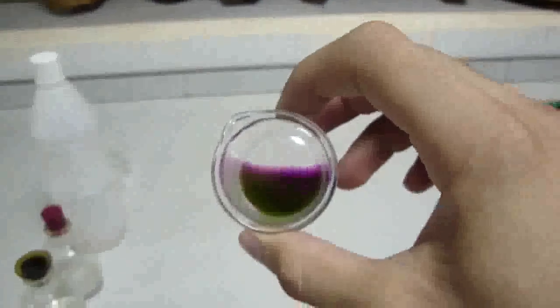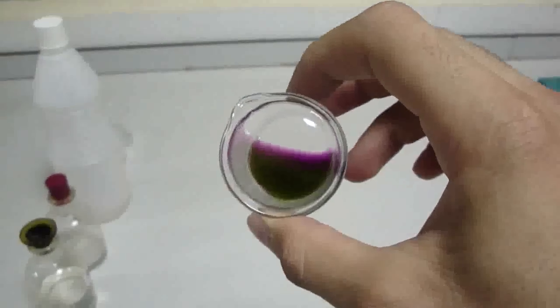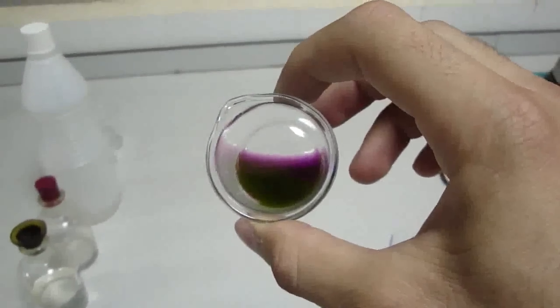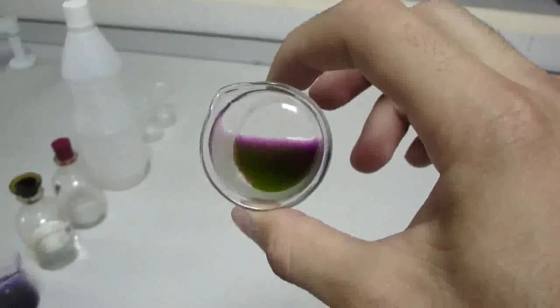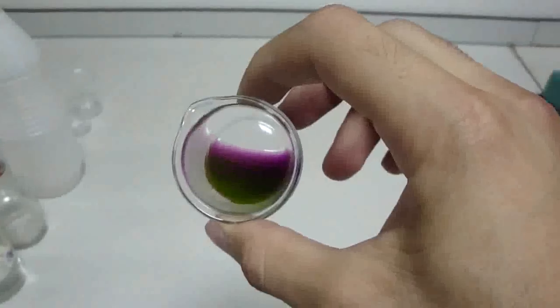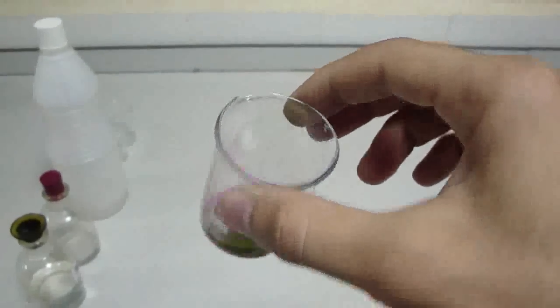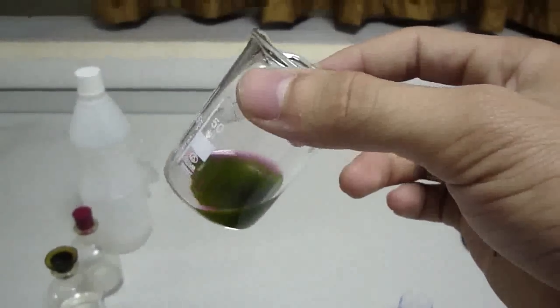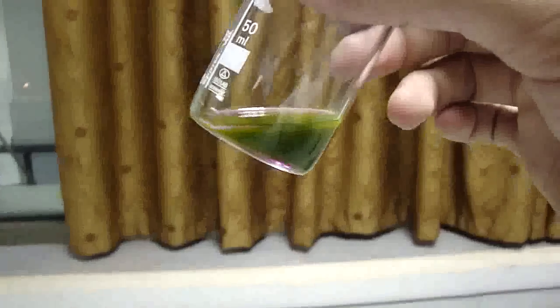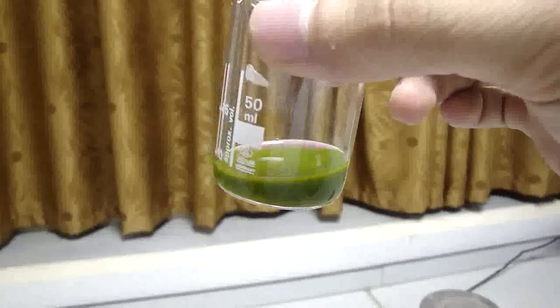If we take a negative picture, we will see that the opposite has happened. The violet will be green and the green will be violet. So this green color is the complementary color of the violet.